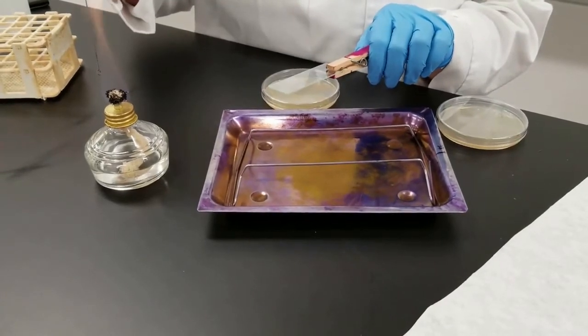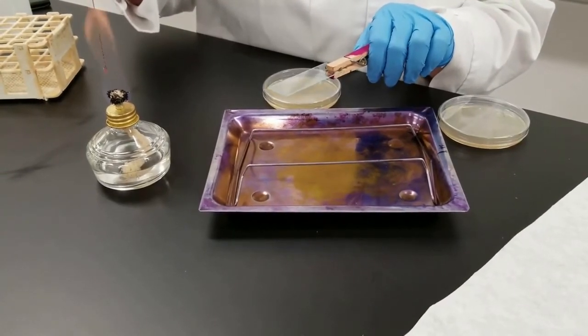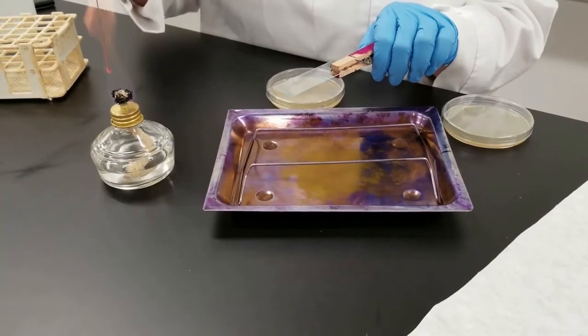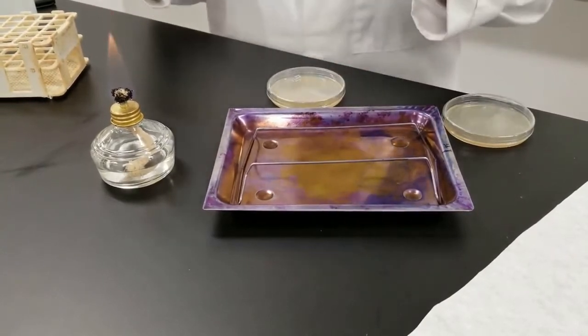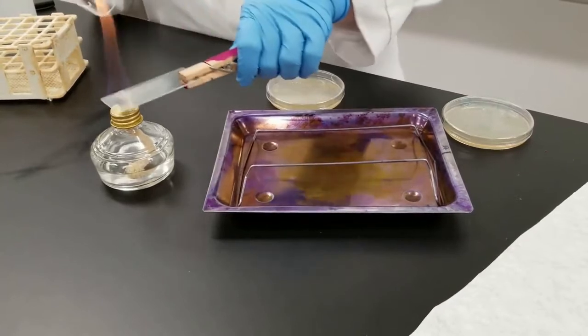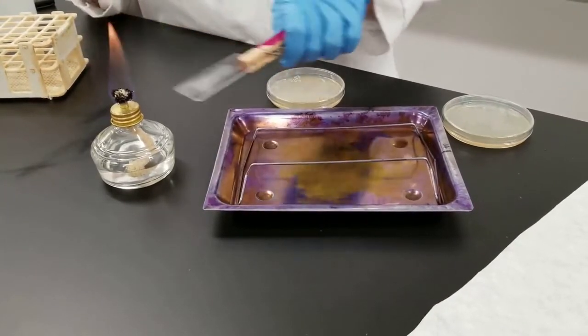We need to heat fix. Once you have done a smear, that is going to adhere the bacteria to the slide, kill it, and also make the stain easier to penetrate through it. So that's what we're doing right now, heat fixing it.